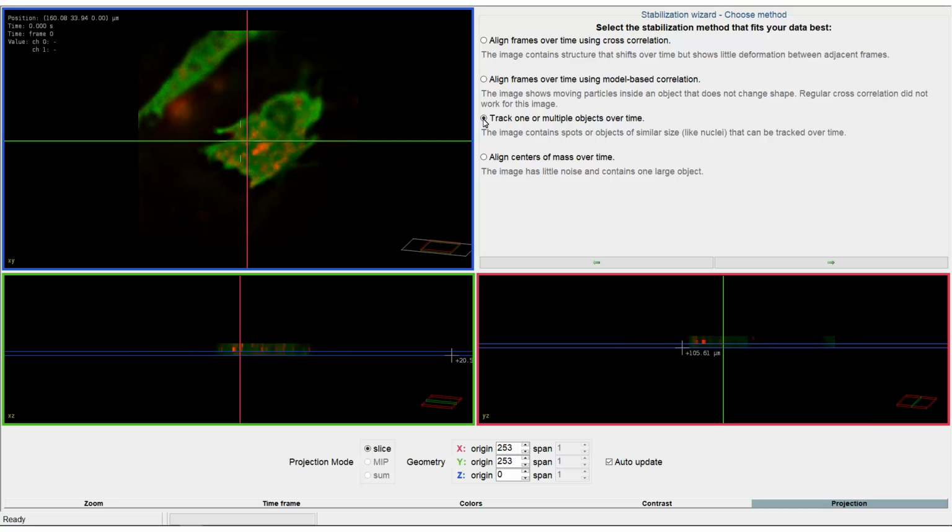The one or multi-object tracking method. When the image contains well-defined objects, the image might be stabilized using object tracking. The objects are interactively selected, similarly as in the object tracker, and tracked over time, and their average movement is used to stabilize the time series. The Center of mass alignment method. This method works best if the image contains a single large object. No objects should cross the image borders, and the contrast between object and background should be high.